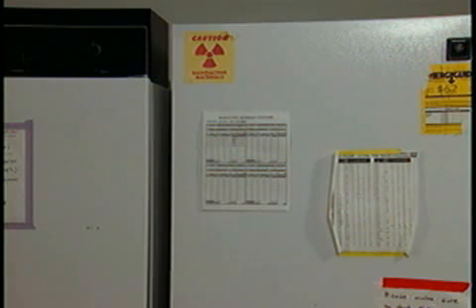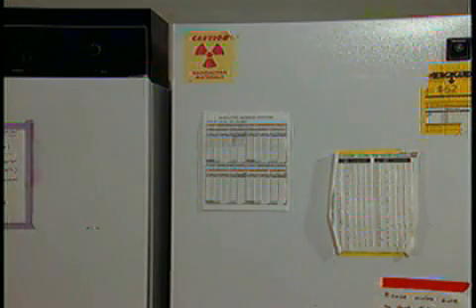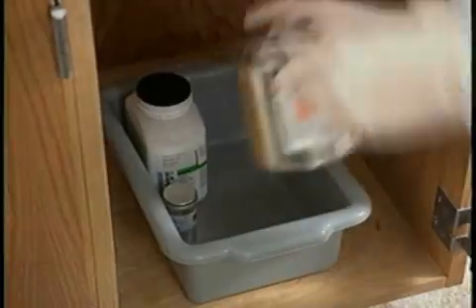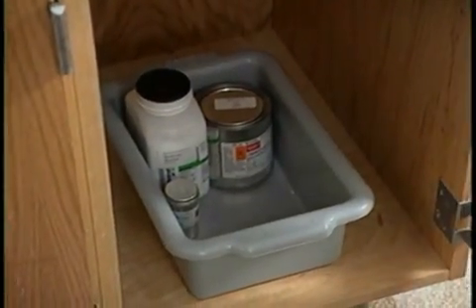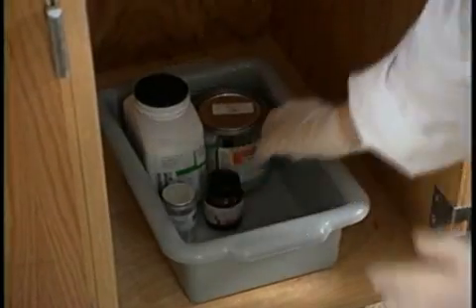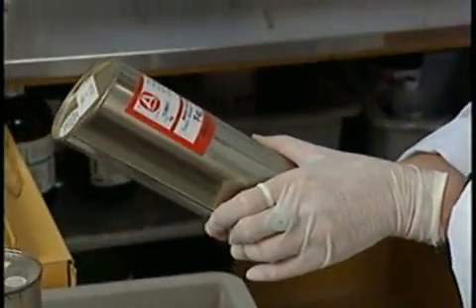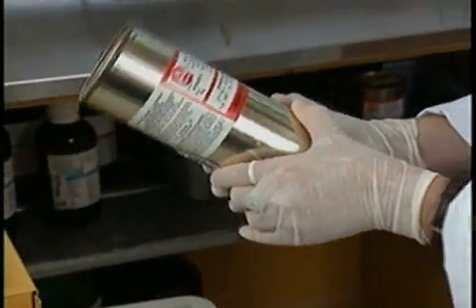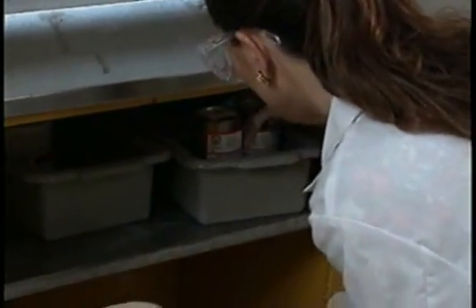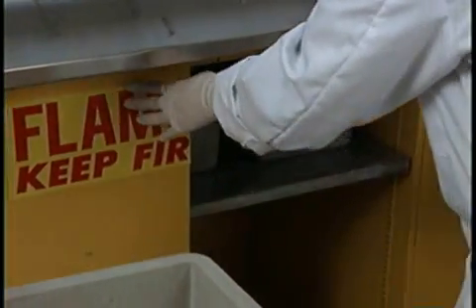Don't store flammables in a refrigerator unless it's approved for such storage. As for toxic materials like carcinogens and reproductive hazards, Lisa and Mario will keep them in a separate cabinet. Any toxic materials that are also volatile belong in a vented enclosure, such as the flammables cabinet. Keeping an inventory of all highly toxic and highly reactive chemicals is good safety and good sense.